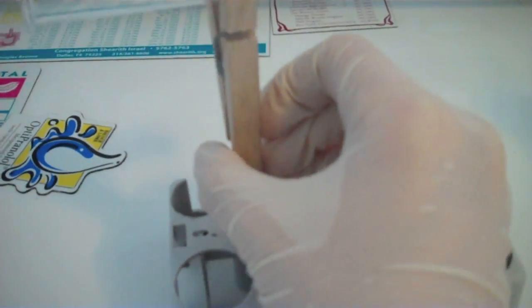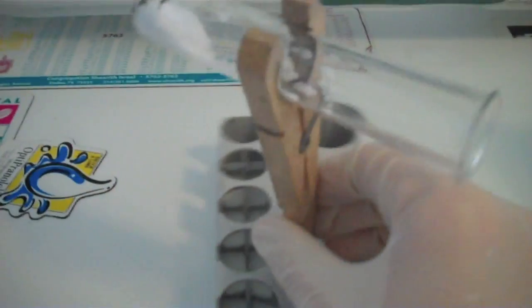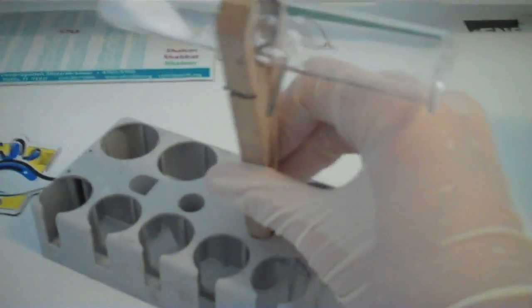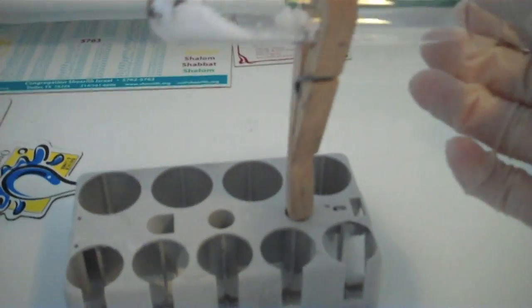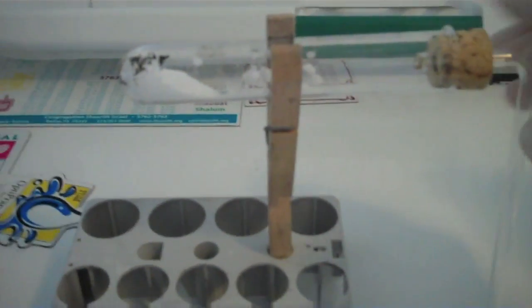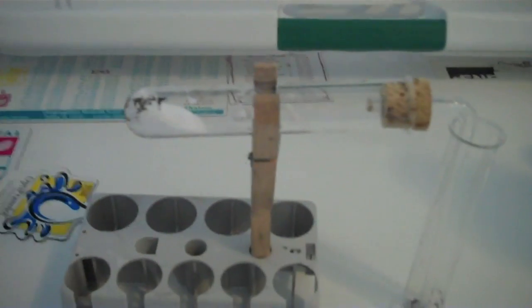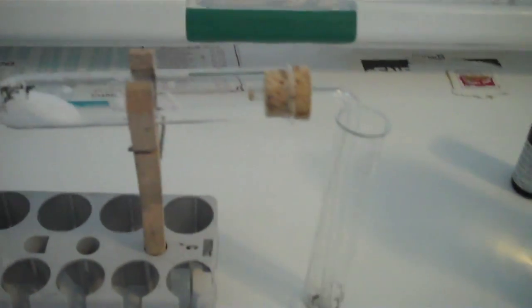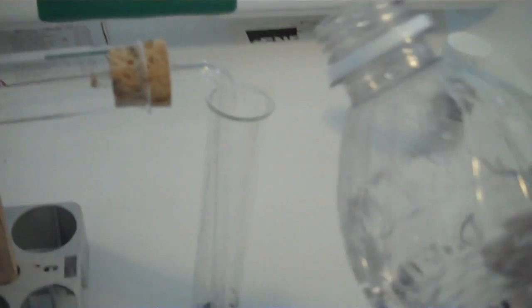You want the test tube to be angled like this, straight forward and a little bit tilted down. So I have my angled glass tube from the test tube which is going to be heated.